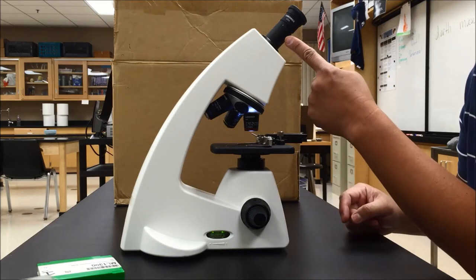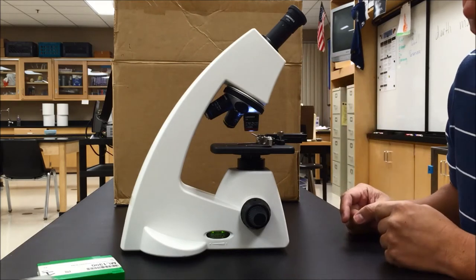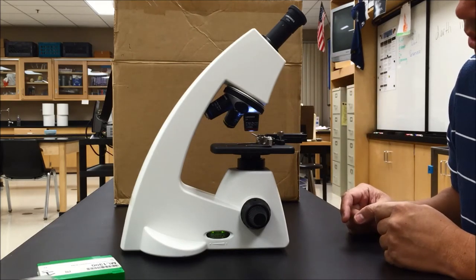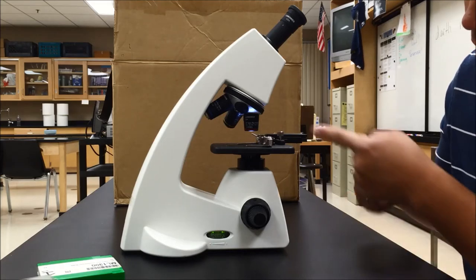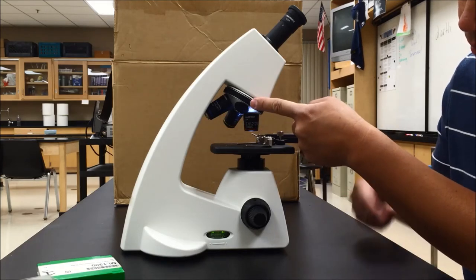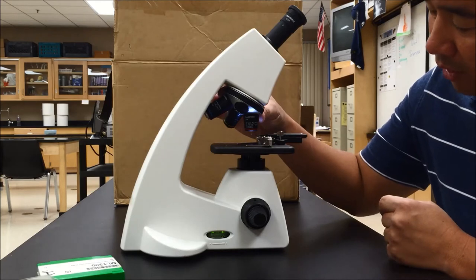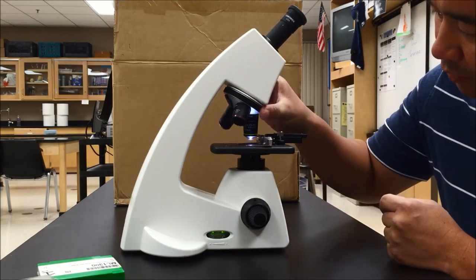Next is the eyepiece. The eyepiece has a magnification of 10 times, followed by the objective lens which is on the turret. In order to change the objective lenses you simply have to turn the turret.